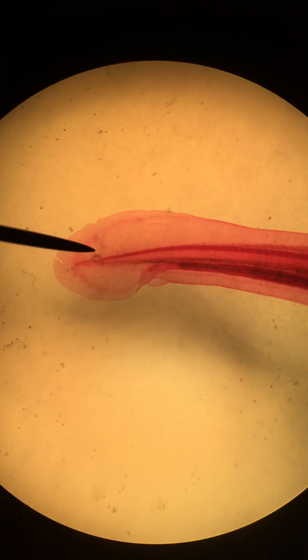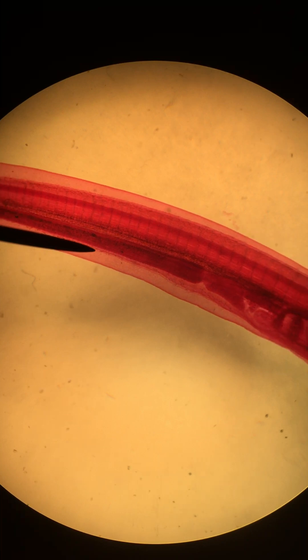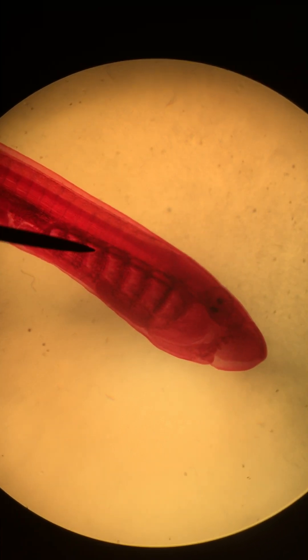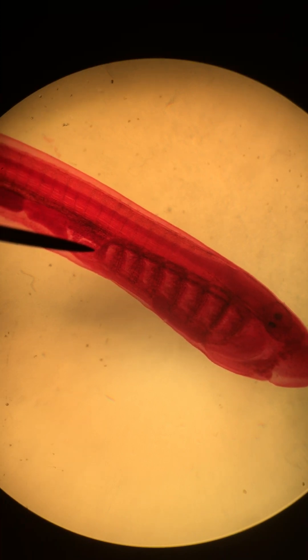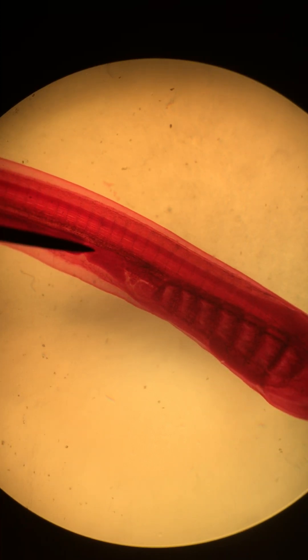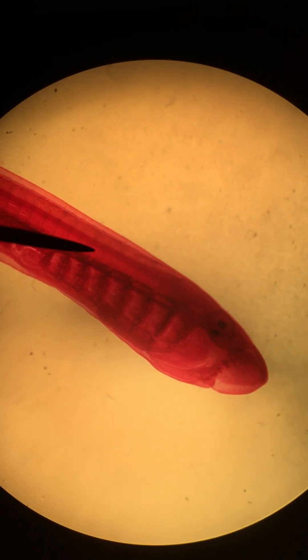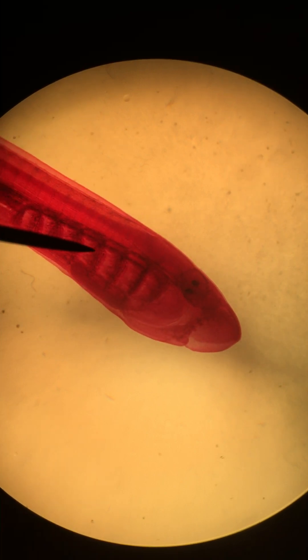I'll talk you through everything that we can see here. It does look kind of like the whole mount of the Amphioxus; however, it has a lot more specialization, more functional structures in our Ammocoetes versus the Amphioxus.